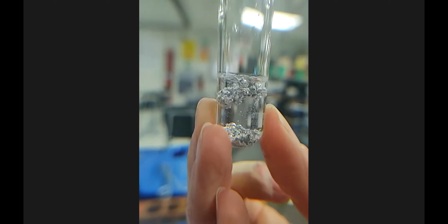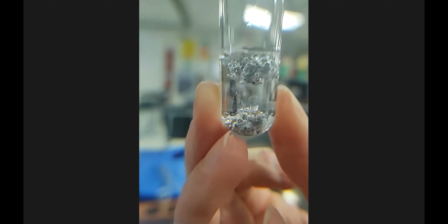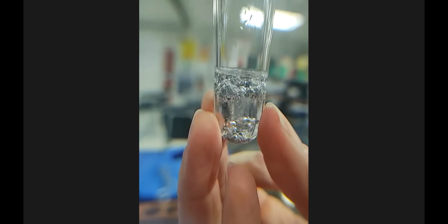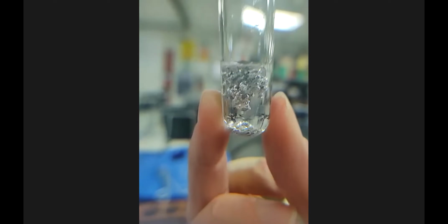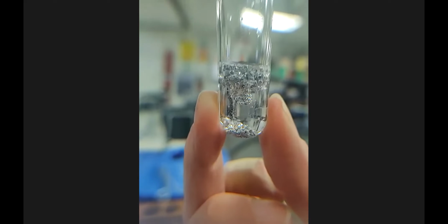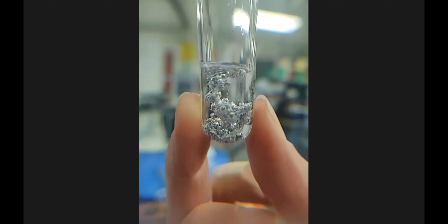So is the stuff on the bottom like zinc plus bubbles? Like the solid looking stuff? You definitely have bubbles. You definitely have zinc in here, and it's in the hydrochloric acid. So there are bubbles forming on the zinc because it's so fine, as I pointed out. The bubbles make it buoyant, which makes it fun. And then when the bubbles pop and are not in that solution, then the pieces fall back down.